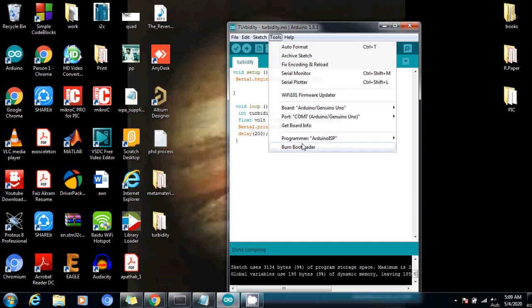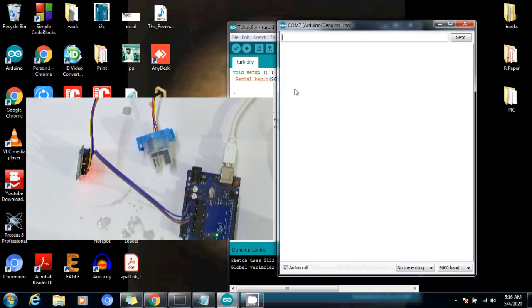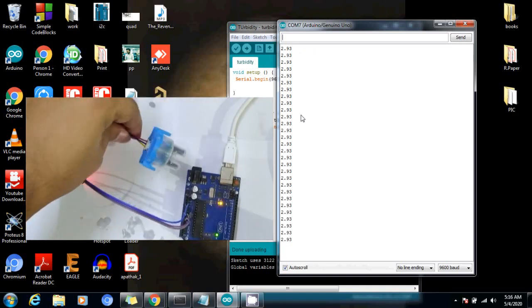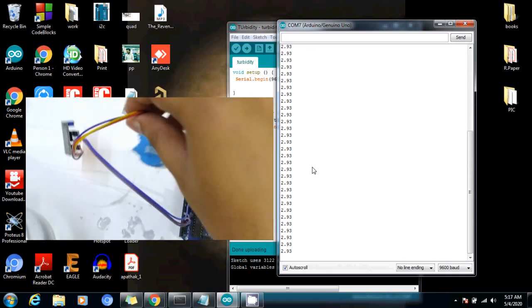And now let's upload the code, but first of all select the microcontroller, the Arduino. Okay, it's selected and now let's upload the code. As you can see, the uploading is done and now let's see the serial monitor here. So the turbidity is reading 2.93 and let me just put this turbidity sensor in the water.